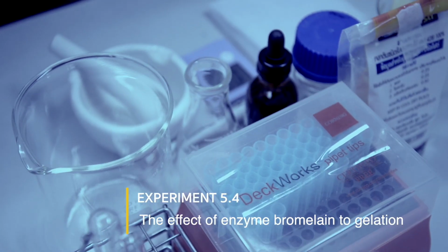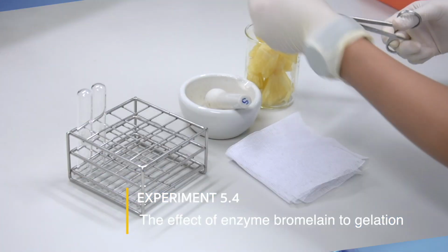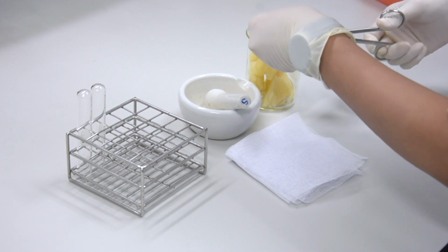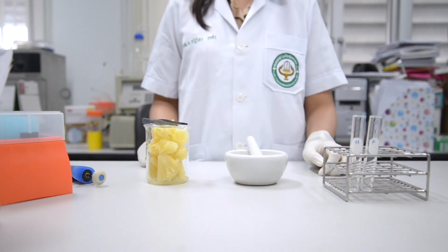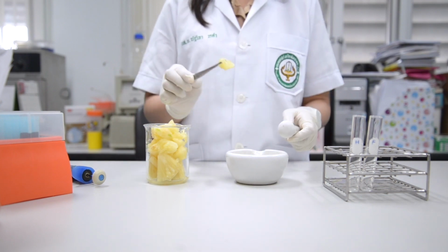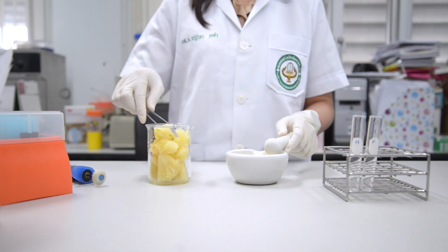Experiment 5.4. Effect of enzyme bromelain on gelatin. Bromelain, which is present in large quantity in the fruit, leaves, and stem of pineapple, is a proteolytic enzyme or protease that catalyzes the breakdown of protein into amino acids.